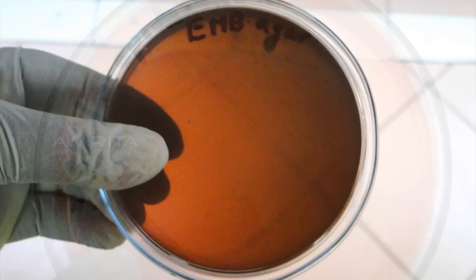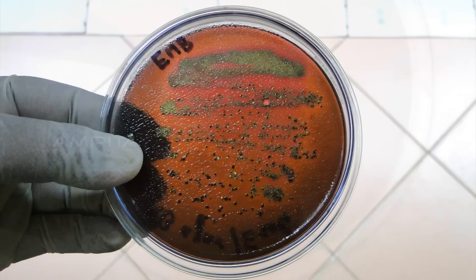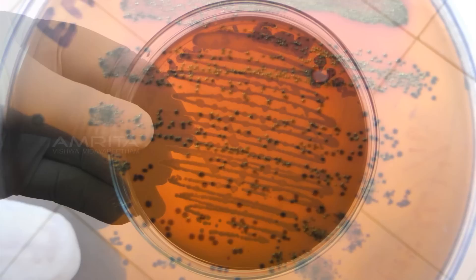Eosin-methylene blue agar is both a selective and differential medium, used for the detection and isolation of gram-negative intestinal pathogens. In Eosin-methylene blue agar, Escherichia coli produces dark blue-black colonies with a metallic green sheen, indicating vigorous fermentation of lactose and acid production.